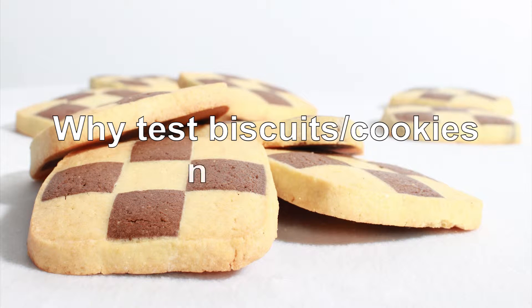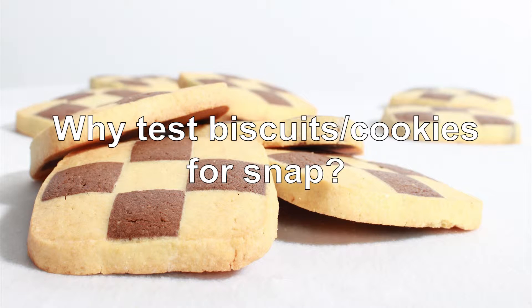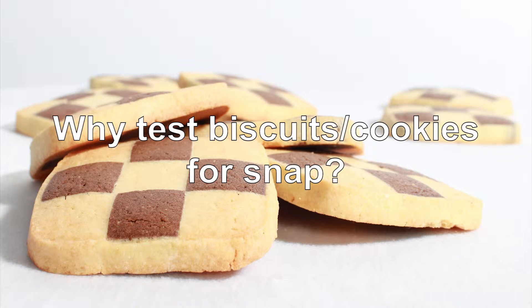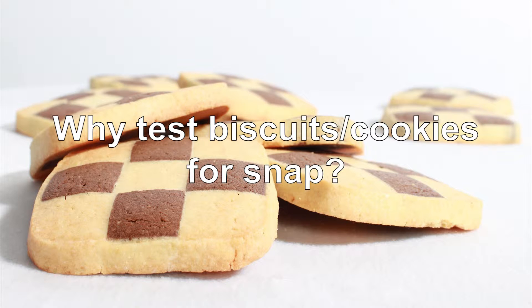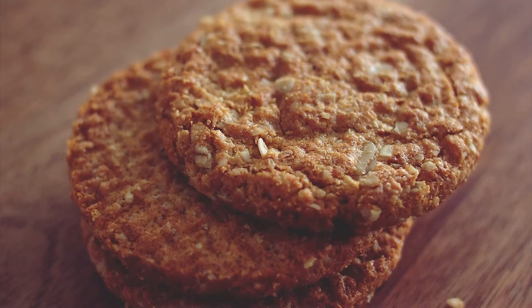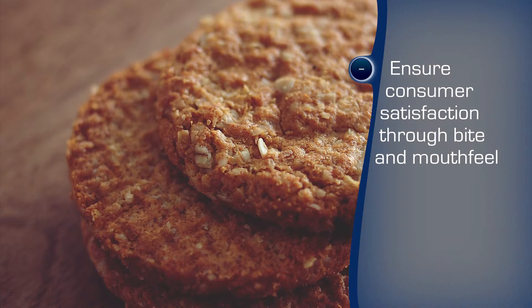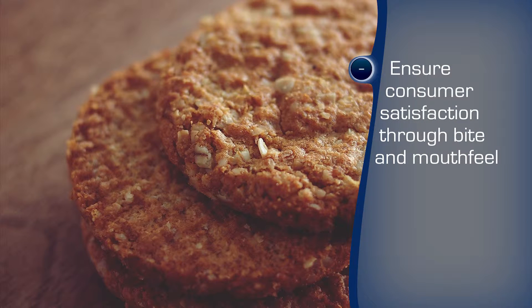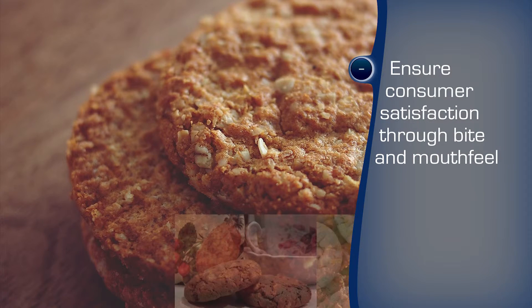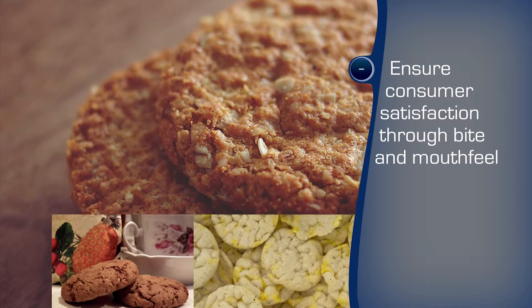Bakery products have specific anticipated textures and staling can change this expectation quickly and dramatically. Products which are expected to be hard go soft and vice versa. Foods that are homogeneous particulate solids when fresh should be crisp and crunchy with a brittle texture that allows snapping and breaking.